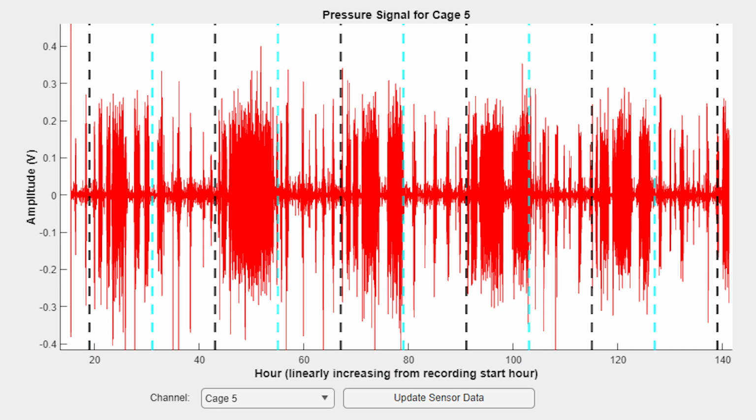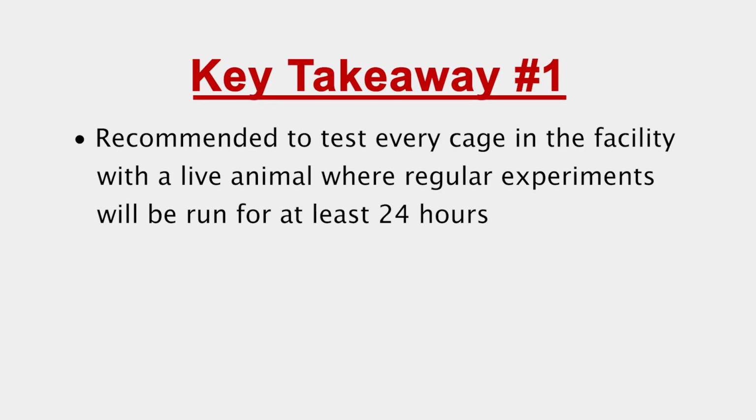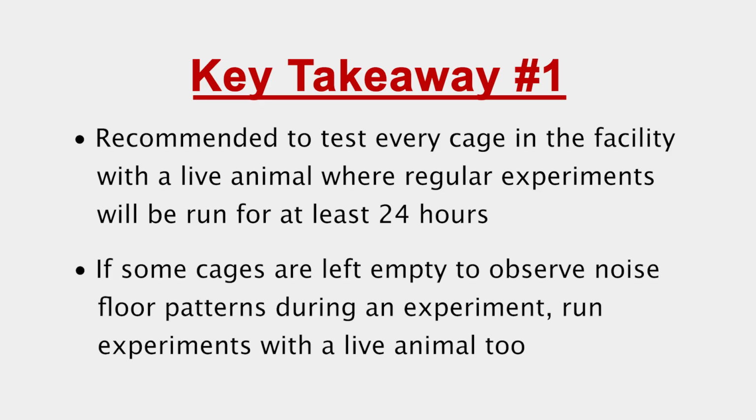This video presented a few examples of identifying good signal quality from the spectrogram. The spectrogram allows us to observe large sections of time in low activity regions to observe the critical signal and noise patterns. It is recommended that every cage be tested with a live animal in the facility, where regular experiments will run for at least 24 hours. If some cages are left empty to observe noise patterns during an experiment, then another experiment should be run to have an animal in these cages.